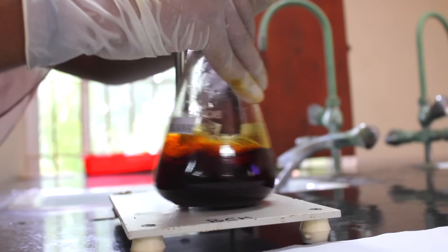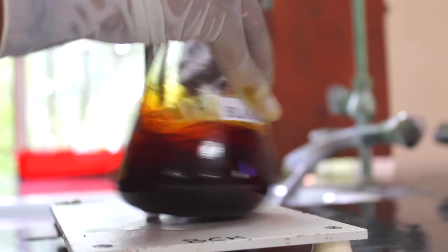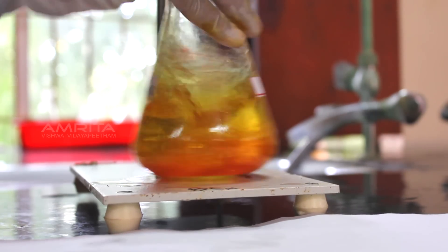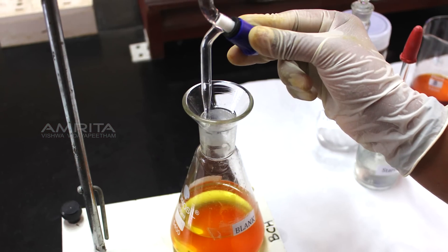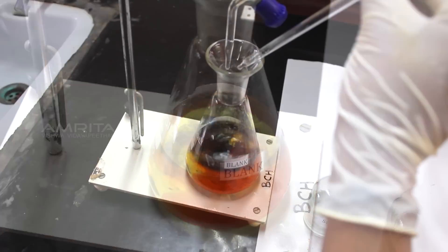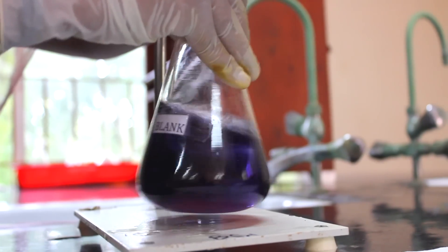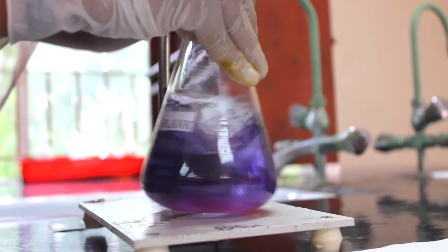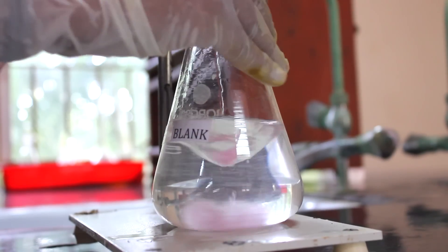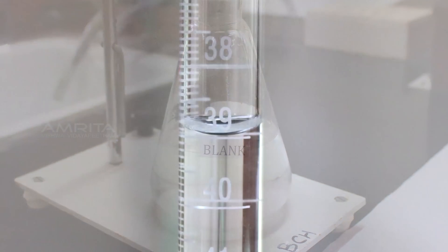The contents of the flask labelled blank are then titrated against 0.1 normal sodium thiosulphate. Continue the titration till the solution turns to pale straw colour. Now close the stopcock of the burette and add 1 ml of starch solution into the flask. The colour of the solution changes to purple-blue. Titration is continued until the colour of the solution turns colourless. The disappearance of the blue colour is recorded as the end point of the titration.